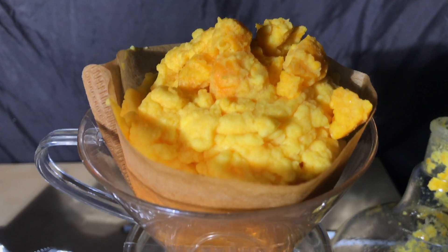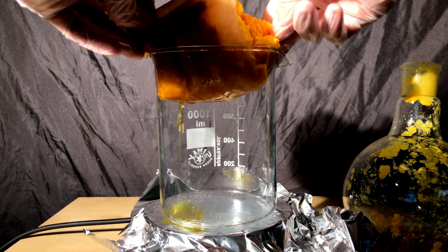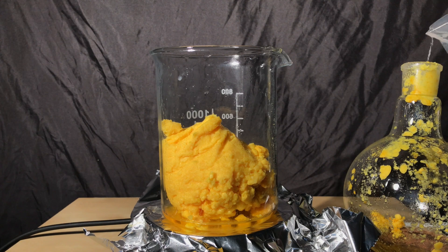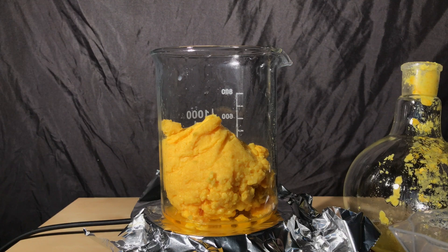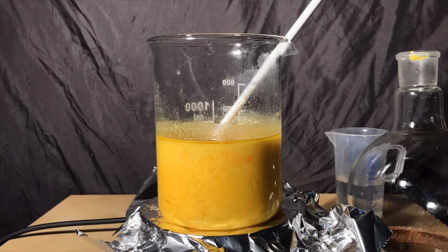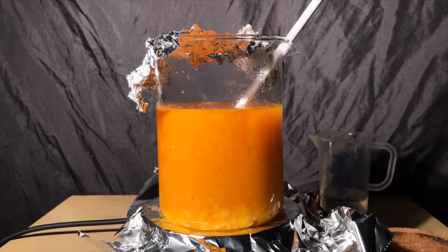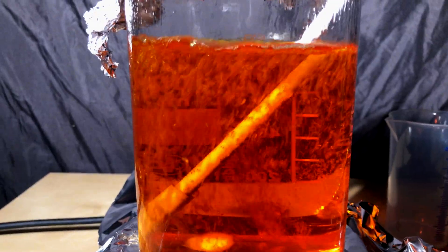In the end we were left with this crude product which reminded me of scrambled eggs. I want to purify the product, so we added everything back to a freshly cleaned beaker to perform a recrystallization. The flask was rinsed using our recrystallization solvent, which was 96% ethanol, to keep the yield as high as possible. The ethanol was brought to boil and just enough additional ethanol to dissolve all of the crude product was added. Any leftover benzaldehyde, potassium cyanide, or other impurities will be removed during this recrystallization.